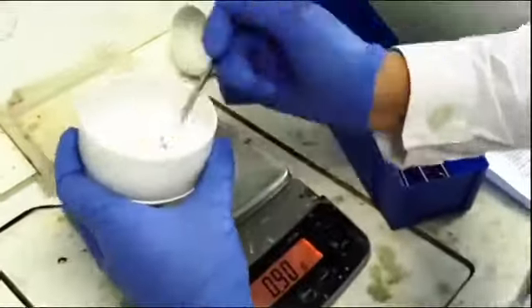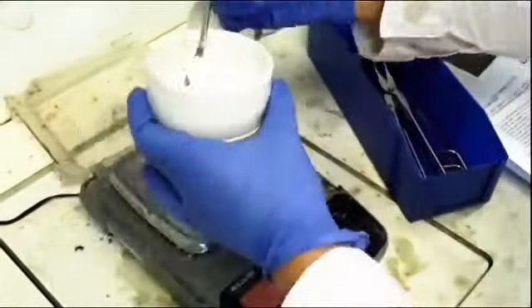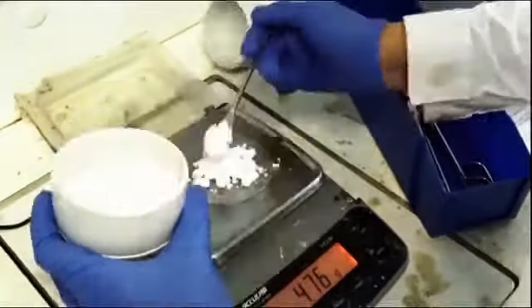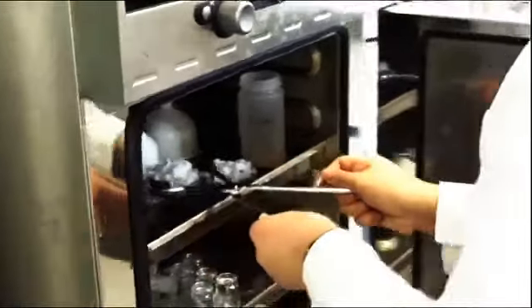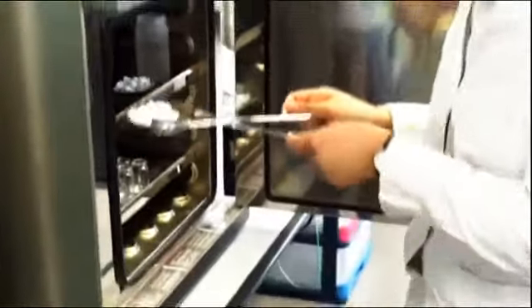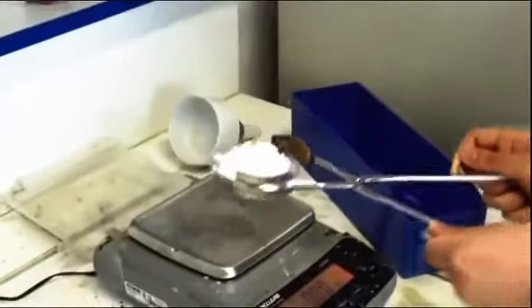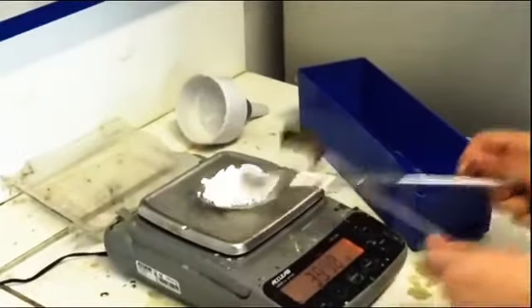There was still water in the aspirin. We weighed the powder before putting the aspirin in a furnace at 90 degrees Celsius to have dry powder. After 24 hours, we weighed the dry powder to compute the yield, and then we compared it to the yield obtained the day before.